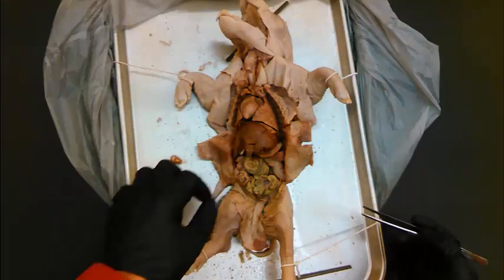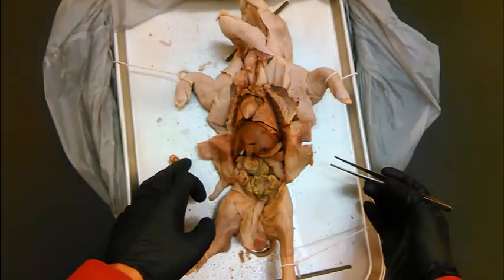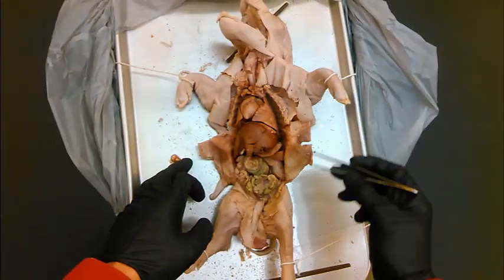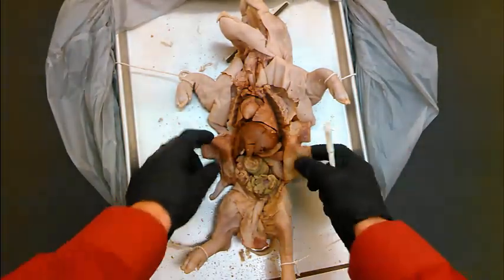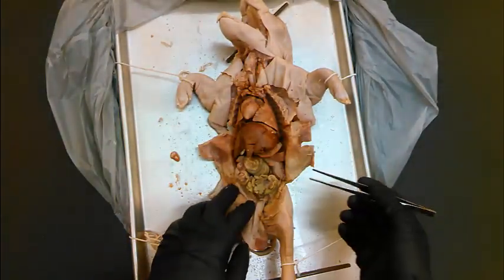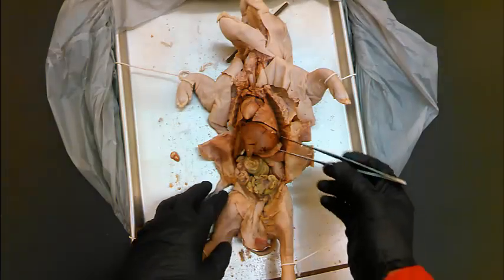Welcome to Anatomy and Physiology at Glen Oaks Community College. I'm Dr. Ren Hartung. For this video we're looking at the digestive system of the fetal pig. I've already dissected the pig open nicely and I'll just start going through organs.